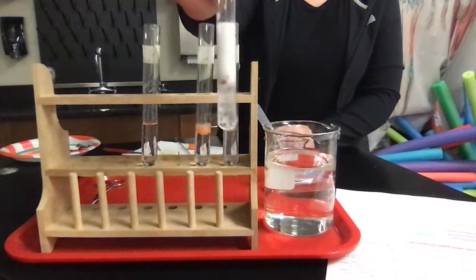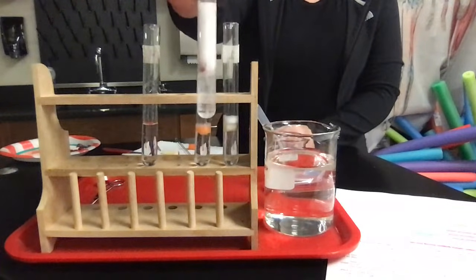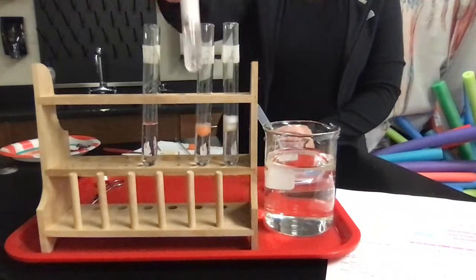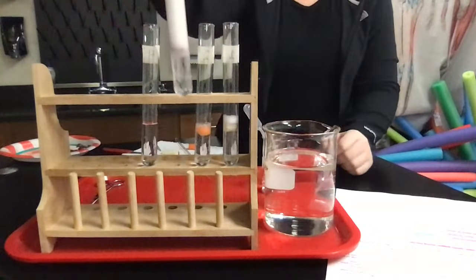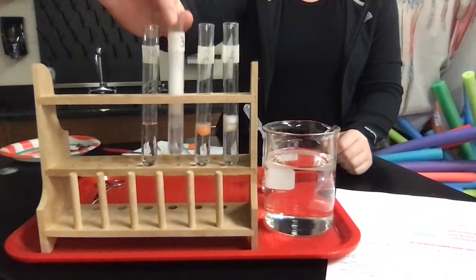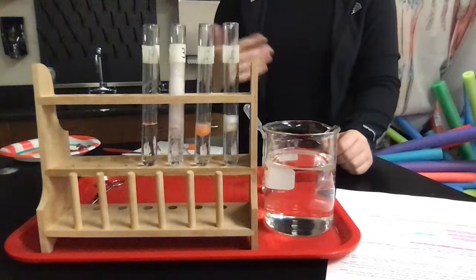So what does that tell you? If you have the highest bubbles, that means that you are having the biggest reaction here, the most enzymatic activity happening. So catalase is breaking down the hydrogen peroxide that we added to each of these test tubes, and it's turning it into oxygen, which you can see as bubbles, and water, which is the remainder in the bottom. Okay, so you can see that all of these specimens have catalase activity.